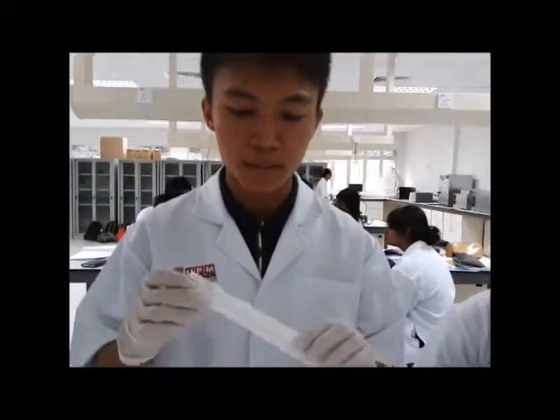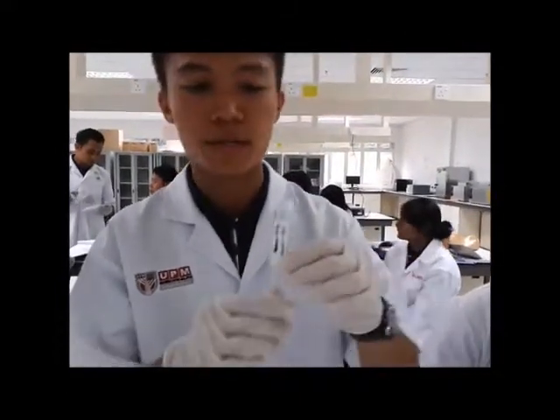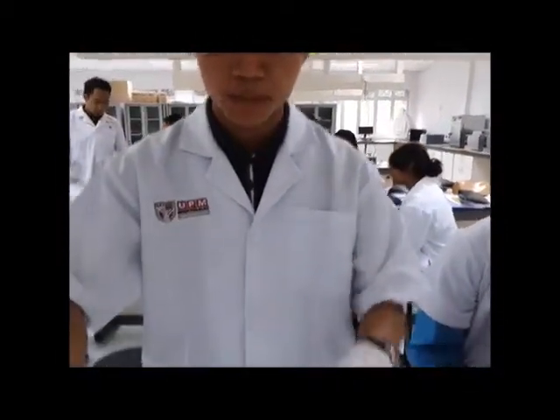Okay, a very good morning. My name is Darian Raja. I'll explain the next step. We use the pipette labelled E, in which we will take 1 ml of the enzyme and add it into the enzyme reaction tube. After adding the enzyme, we will start our timer, in which after 1 minute we will take 500 microliters of this sample and add it into the cuvette E1. So this goes on: after 2 minutes, we will take another sample and add it to E2, and after 4 minutes, 6 minutes and 8 minutes.